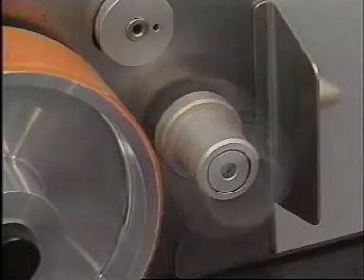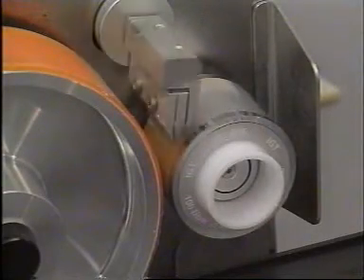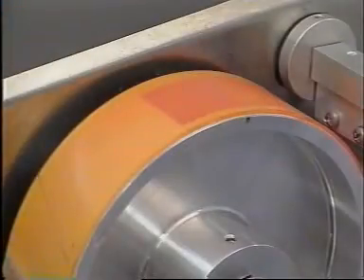The F1 functions like a printing press: an anilox cylinder with a doctor blade, a printing form, the substrate, and an impression cylinder.